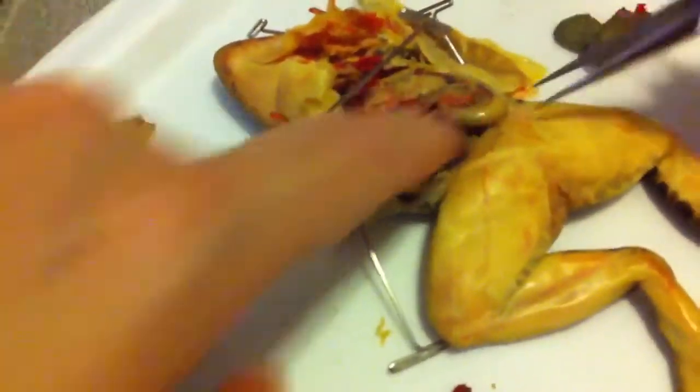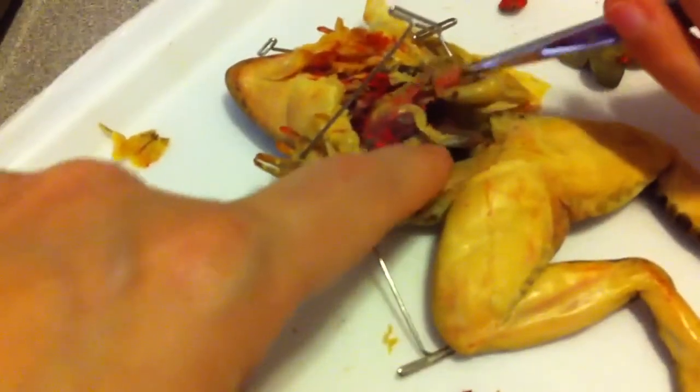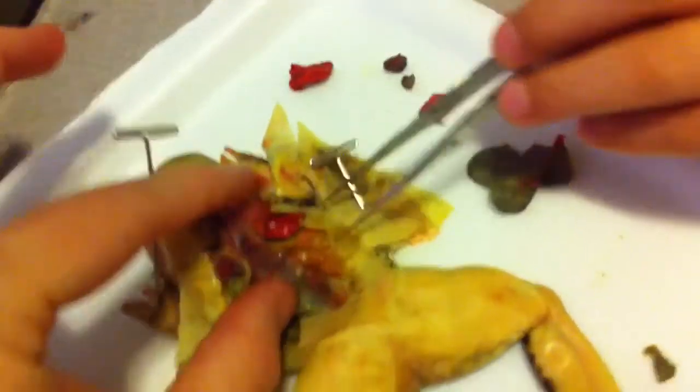And what is this? Remember? His bone. Well, underneath that is the bone. This is the large intestine, small intestine. Underneath is the stomach attached. And there's his bone you've been trying to get to.